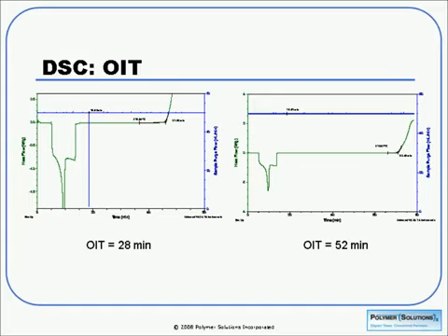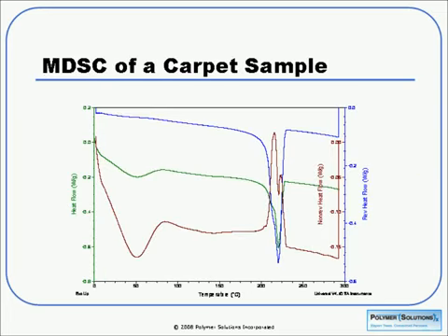And in this case, the green curves represent the heat flow of the sample, and you can see that at some point you start to see an exothermic change, and that's where the degradation is occurring. The time from where you did your gas switch until that onset is our OIT, or oxidative induction time. The sample on the left has a much lower OIT than that on the right. This may mean that either there's less antioxidant present there, or that there's a less effective antioxidant in that sample. So this would be a quick way to measure efficacy of those kind of materials. I will point out that there's an ASTM standard for this, and that's D3895 in case you're interested in more information.